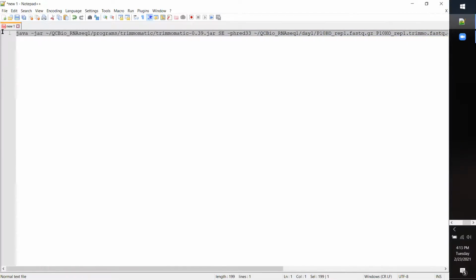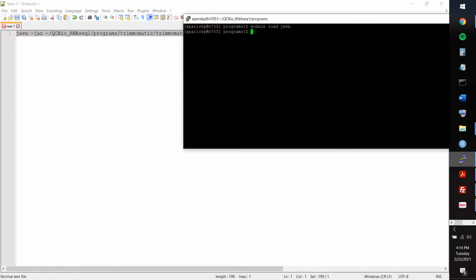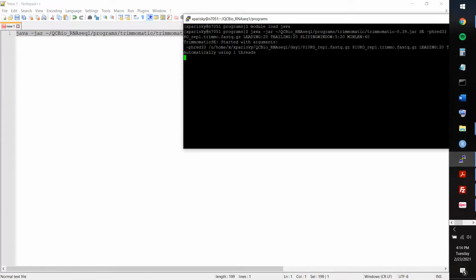And so then now I selected this entire thing and copied it and went back to my shell and pasted it in. And I hope it doesn't hurt anything to run it again. But yeah, oh, sorry, I forgot to add the threads. But it looks like even without that thread command, it's automatically using a single thread.